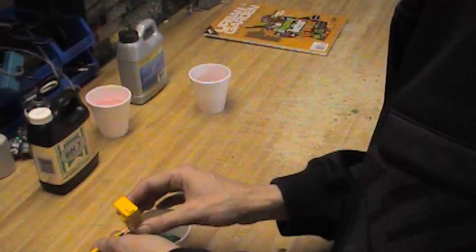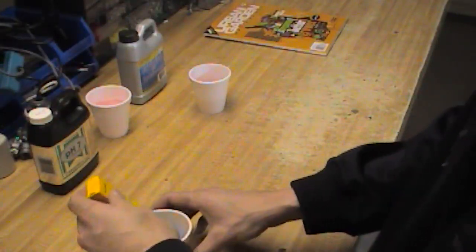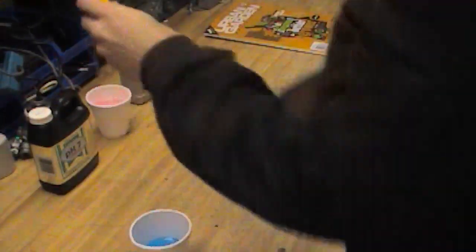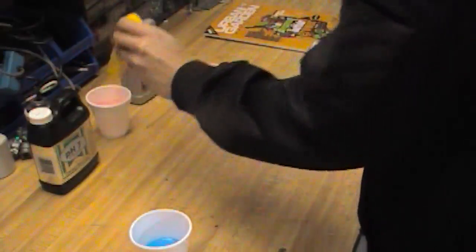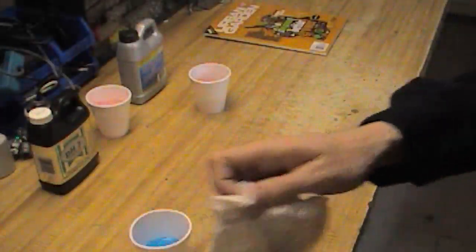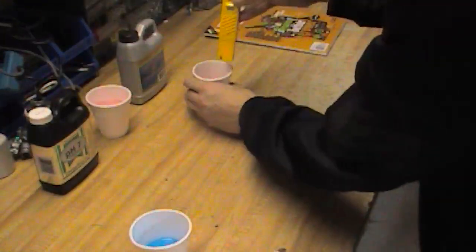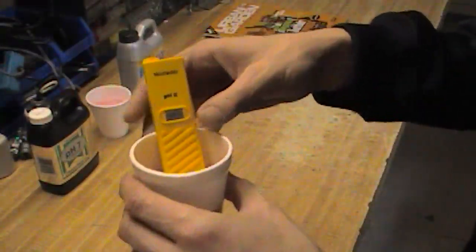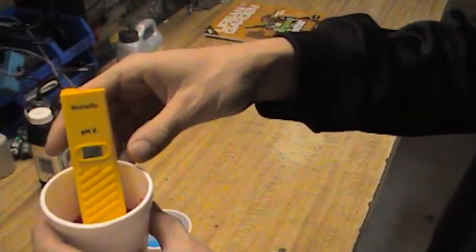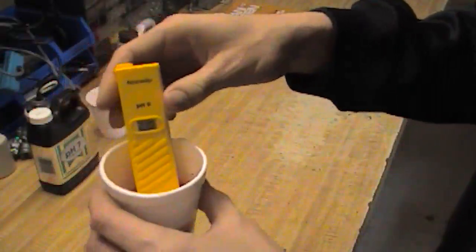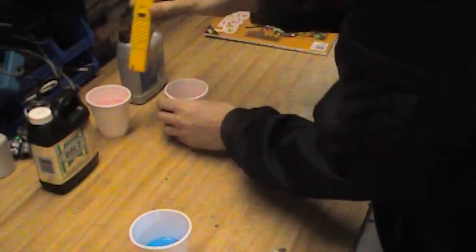Counterclockwise this time. Depending on how far it's out, sometimes the circuitry seems like it's a bit confused, but after a little bit it does end up calibrating when you're using the two screw system here. So now we've got the 4.0 on the money.